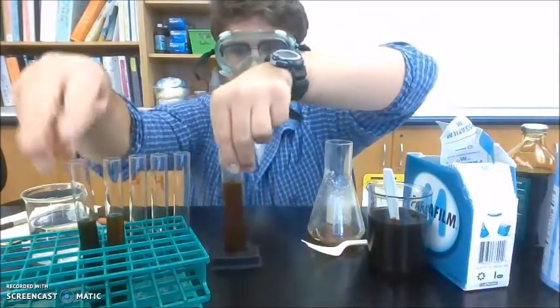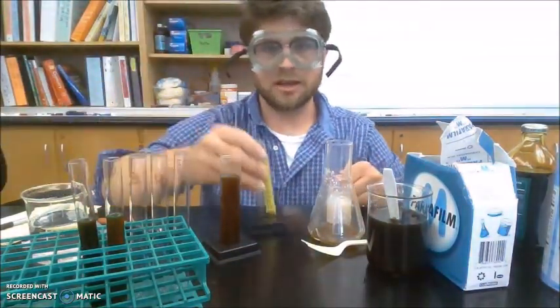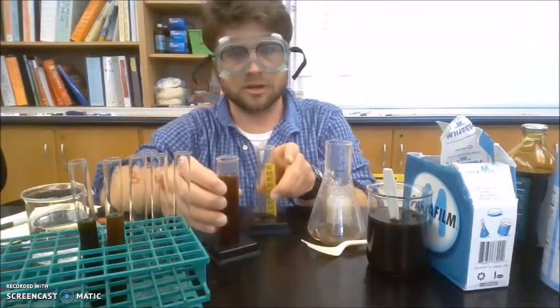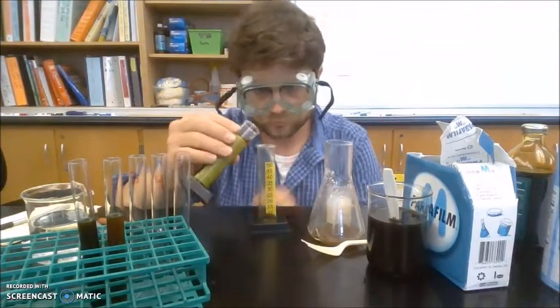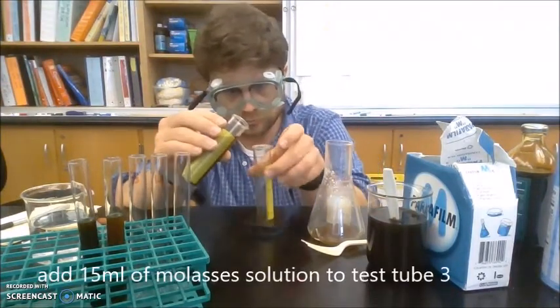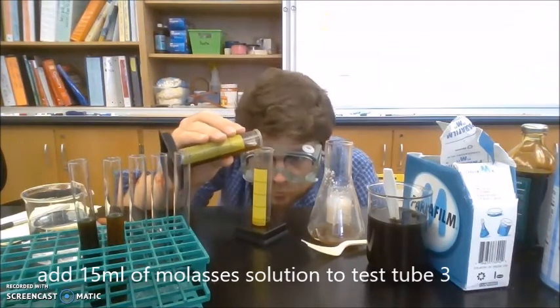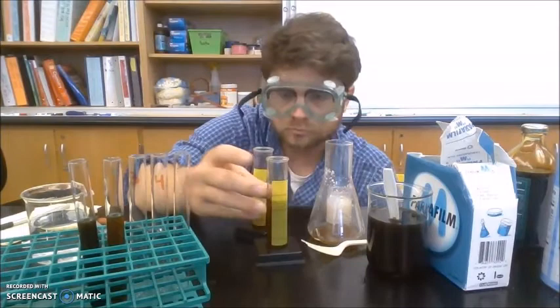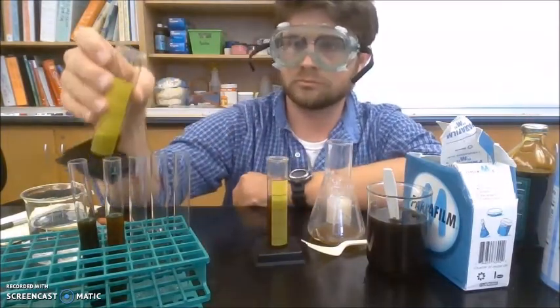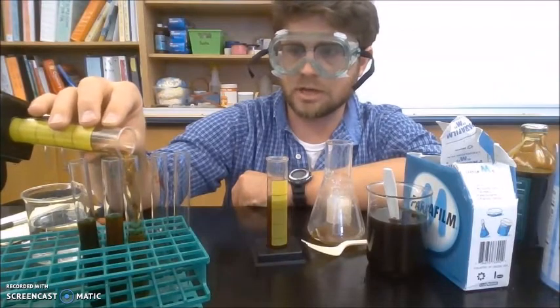So now I want to add 15 milliliters of this molasses and water solution to test tube 3. I have 15 milliliters. I'm adding to test tube 3.